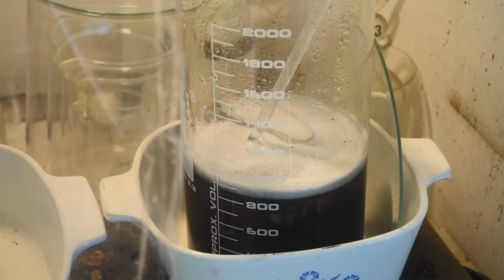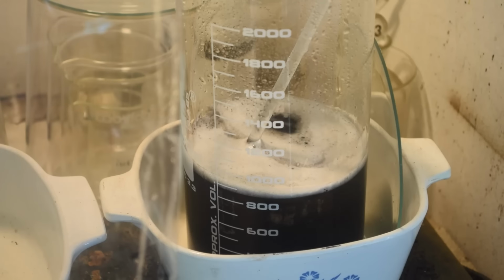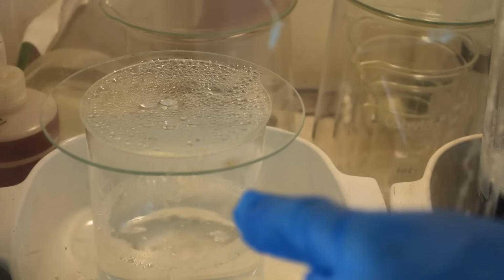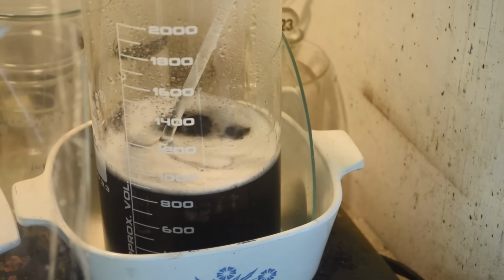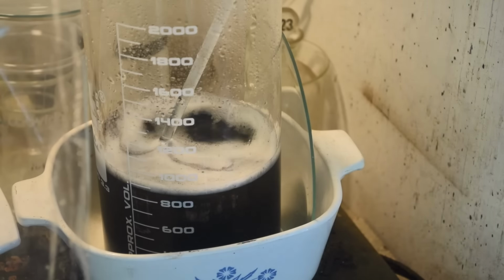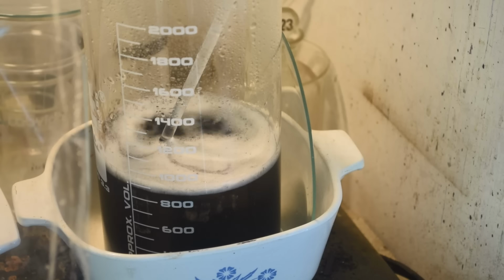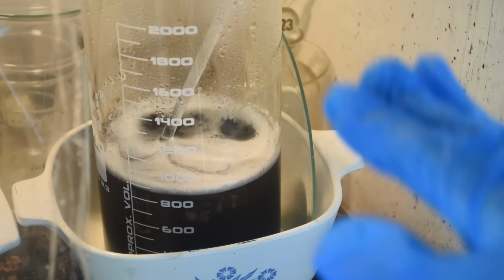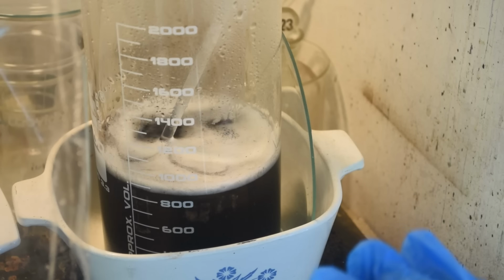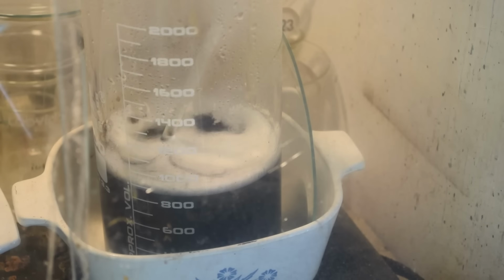So I'm going to let this boil for a little while. We'll see if the liquid clears like she said it will. If not, I can put a little bit more of this stuff in it, but I want to save the bulk of it for the second half of the liquid. But yeah, I see black palladium metal right there. So this is working. We just got to see if it actually clears like she said it will. The palladium may not be pure enough for that to happen. I may just have to take this off the fire and let it settle on its own and then decant off the spent liquid. We'll see. I'm just going to let it go for a while and see what happens.